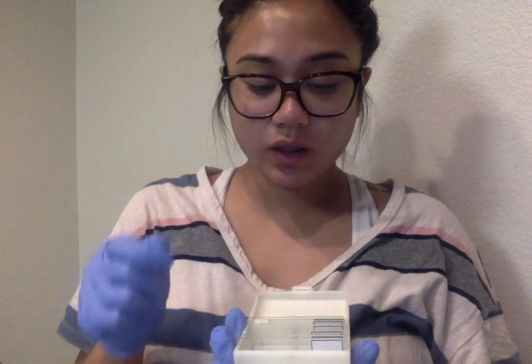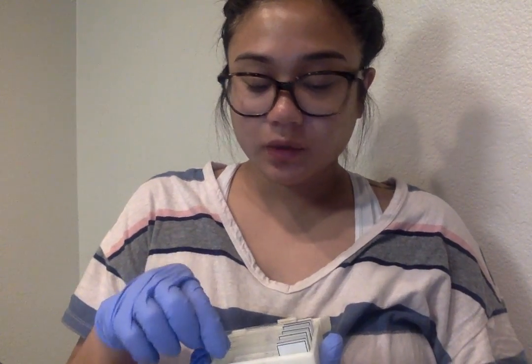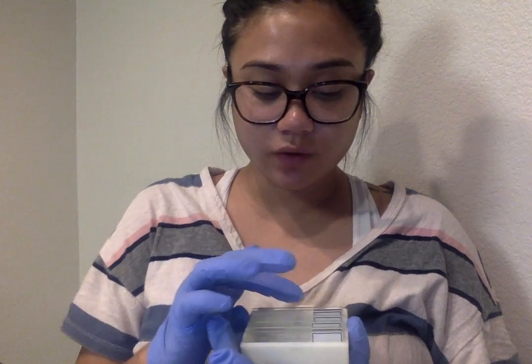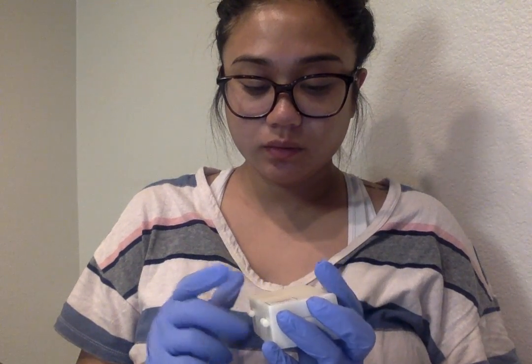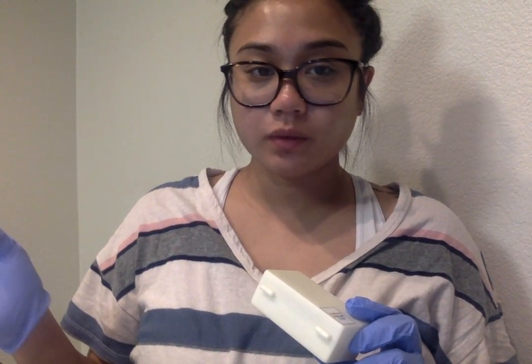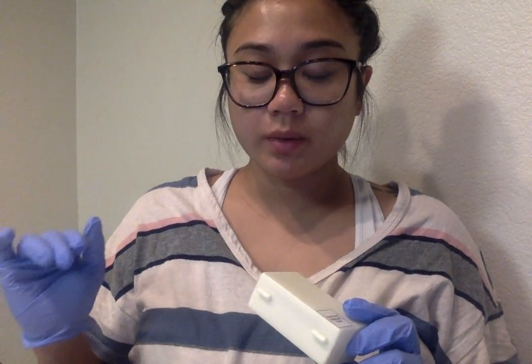identified the letter E, took photos of that under different lenses, and then I did the same for all the other six slides that were here. I identified them, recorded my observations, and then put them in my lab report.